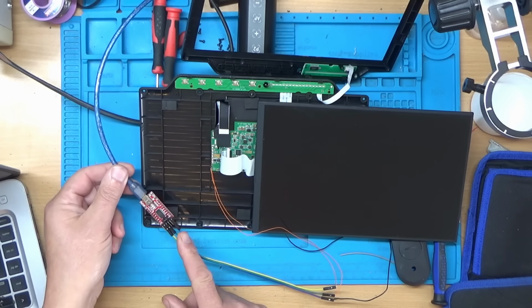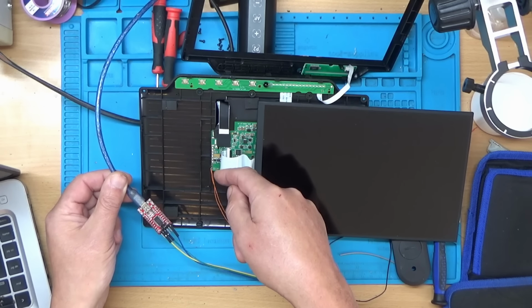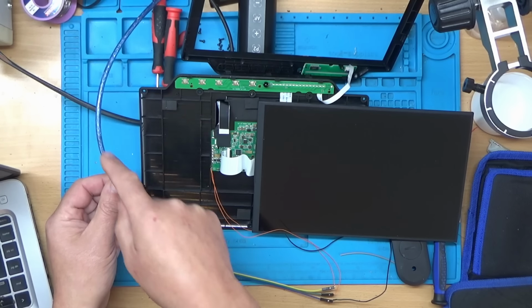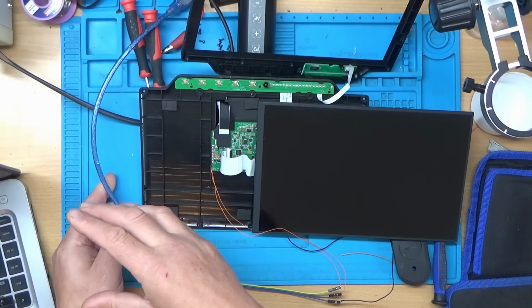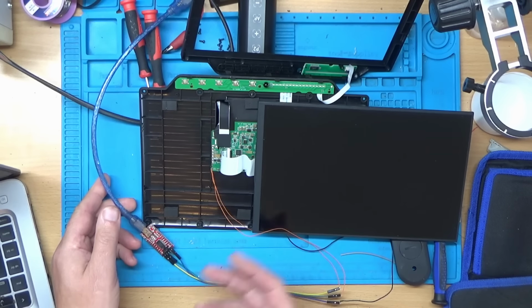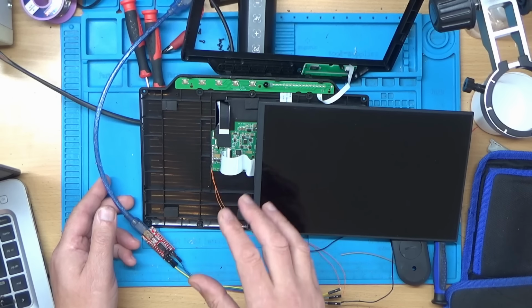So I thought I'd try hooking up this, which is a serial to USB adapter. And what that does, hopefully, is give us some signals on this debug connector here that we can then feed into the laptop using the USB plug. And we should be able to have a look on a terminal window or such to see what data has been spat out here, see if we can see any debug messages or anything that might help. So let's go over to the laptop screen and let's see what happens when we switch this on.